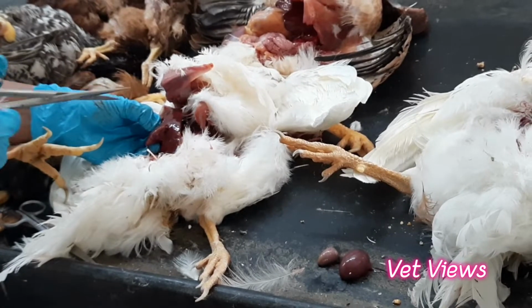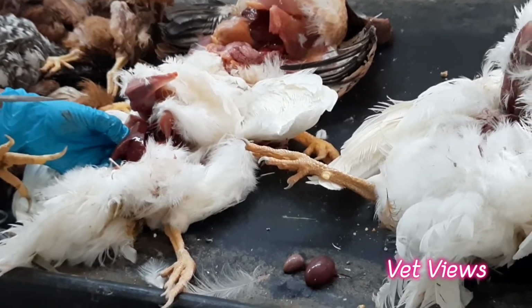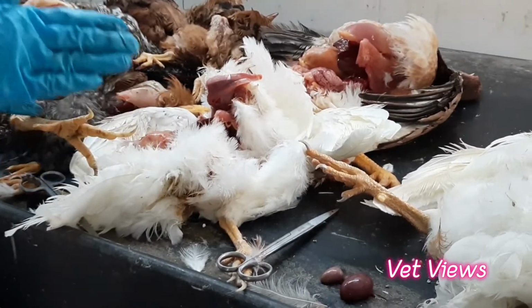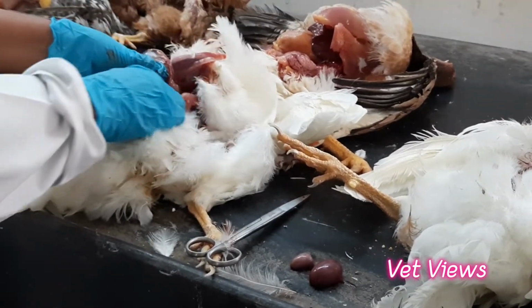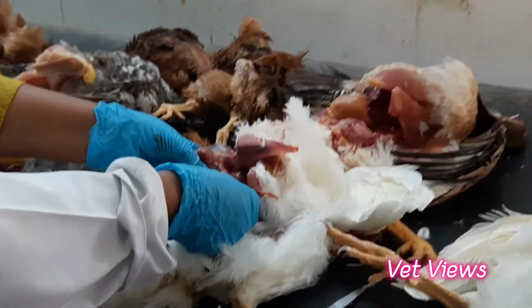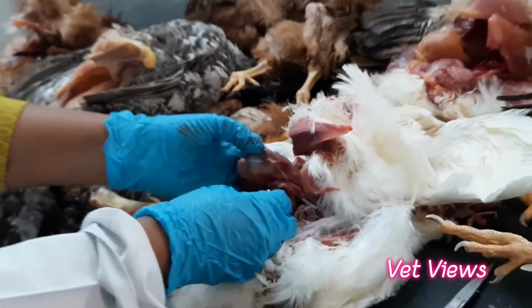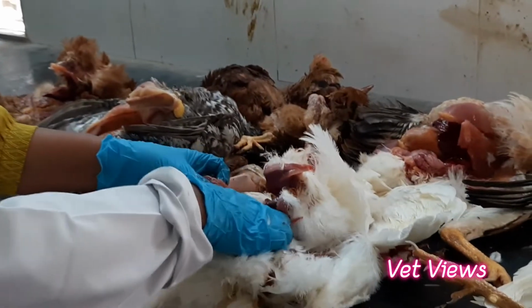So it may have Marek's disease infection, because we are vaccinating all the birds, still some missed birds are there, so they may be sporadic. Followed by spleen. Spleen is an immune organ, so whenever there is a viral infection, you can see the change. On the outside not many changes you can find. So this is a gallbladder. Not much, it's normal in this case, and not many pathognomonic lesions you will find in the gallbladder.